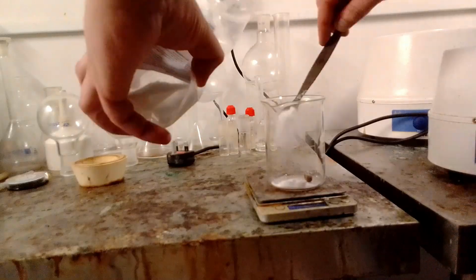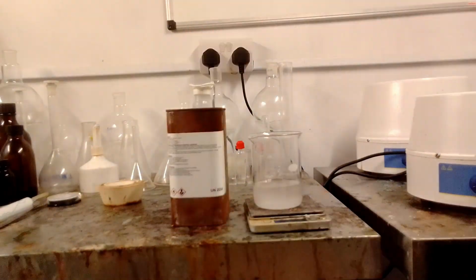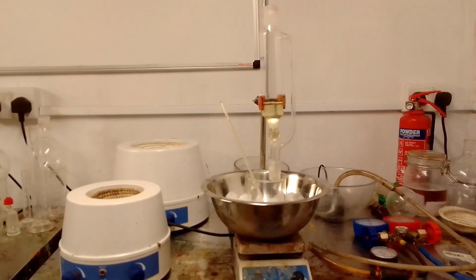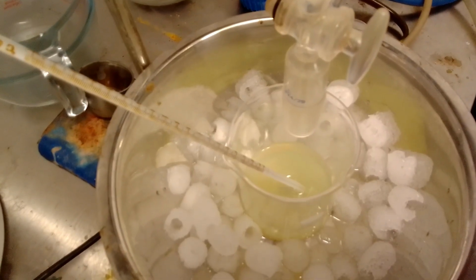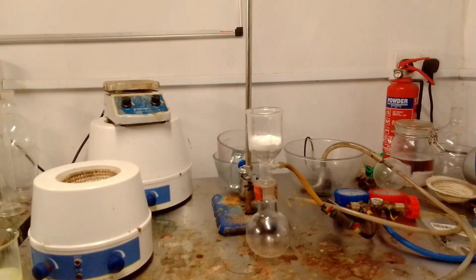Sodium borohydride was dissolved in DMF. Once it was dissolved, pyridine and THF were added to the mixture. While this was happening, the acid chloride solution from the previous step was filtered by gravity into an addition funnel, removing any unreacted acid. The borohydride solution was moved to an ice bath to keep the temperature under control, as this reaction is very exothermic, and the acid chloride solution was added to the borohydride solution dropwise, making sure to keep the temperature under 20 degrees. Once addition was complete, the solution was mixed for another 45 minutes, and all visible gas evolution had ceased.